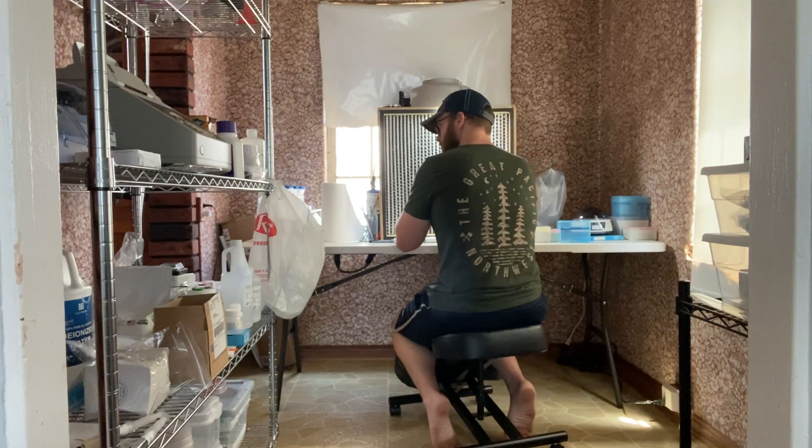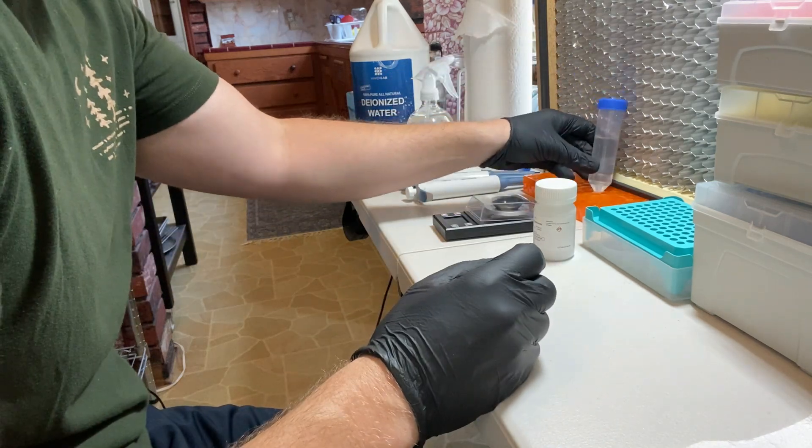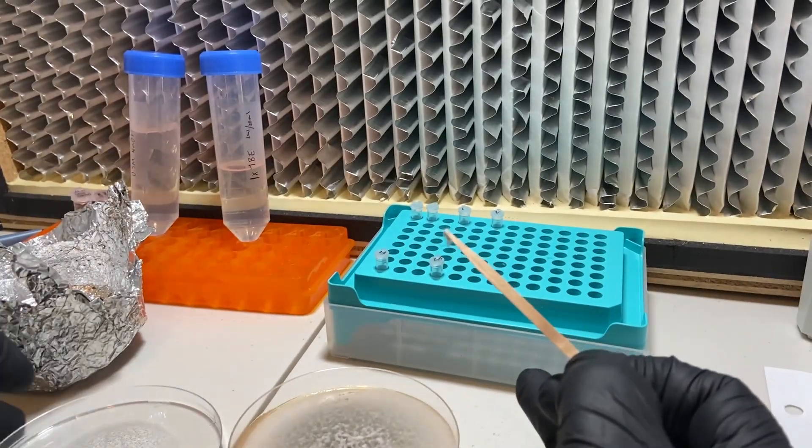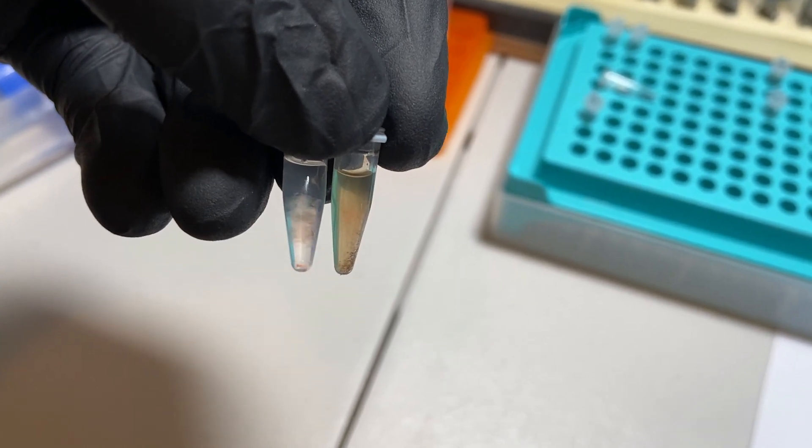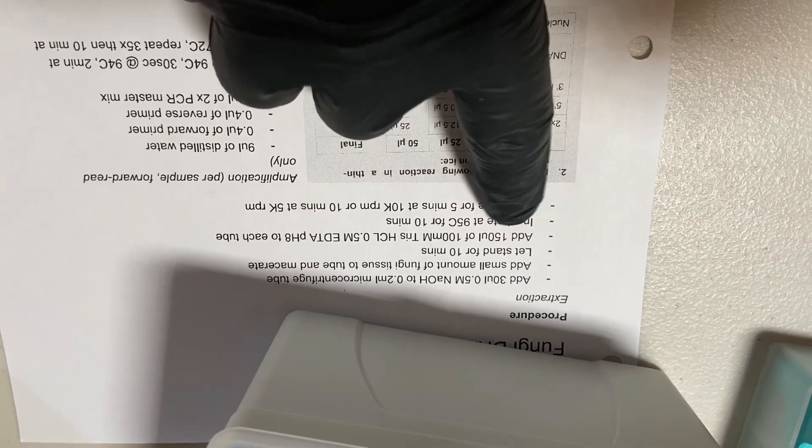In this video, I'm going to show you the process of DNA barcoding fungi from my home lab. As some of you know, I'm learning how to genetically engineer fungi, and one of the most common questions I get is, where do I start? Well, I started with learning DNA barcoding.